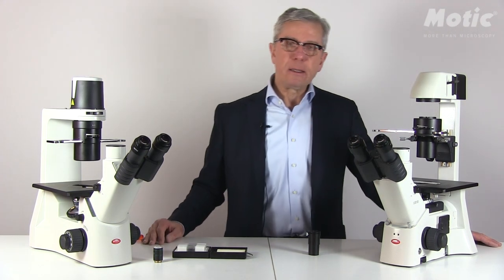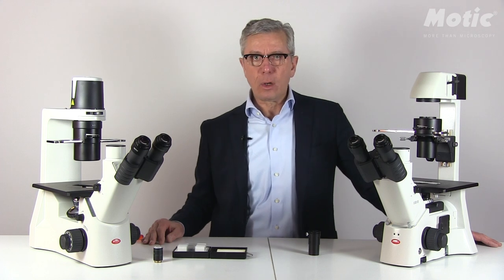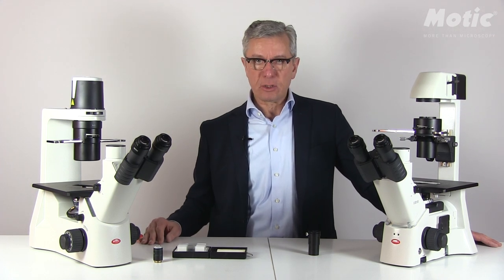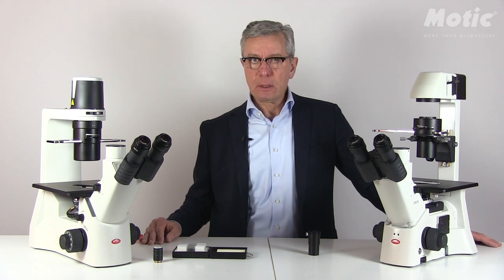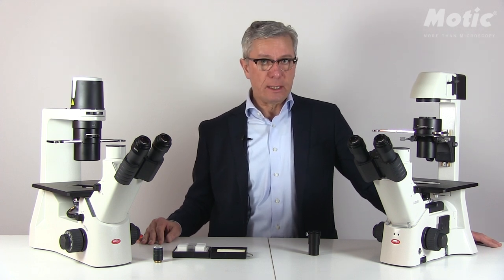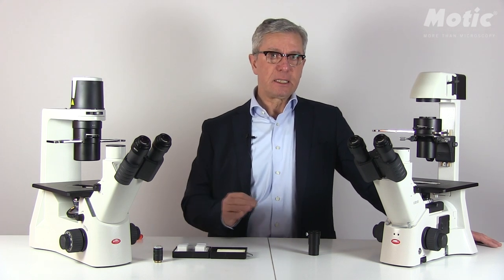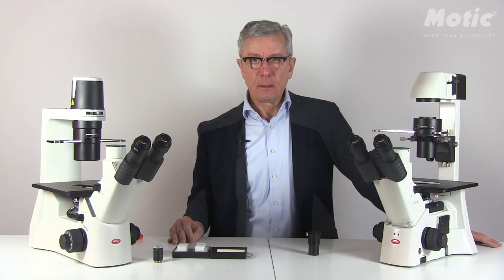Phase contrast is especially meant for thin and/or unstained specimens, and this is of course valid for upright microscope models as well. Please make sure that if you want a satisfying image quality, your sample is really thin and unstained. Thick and stained specimens will not be covered by phase contrast.